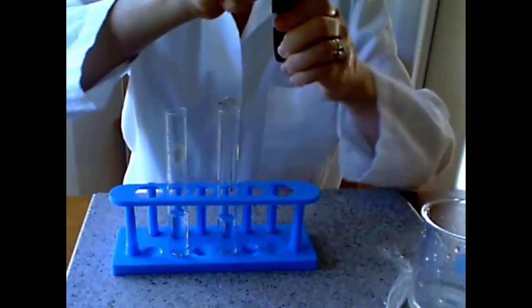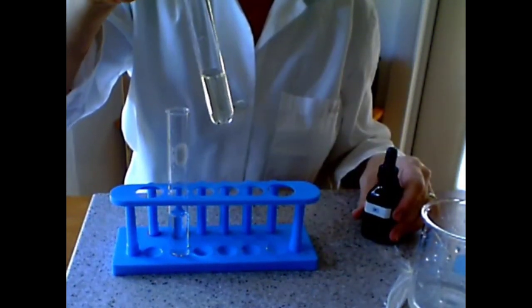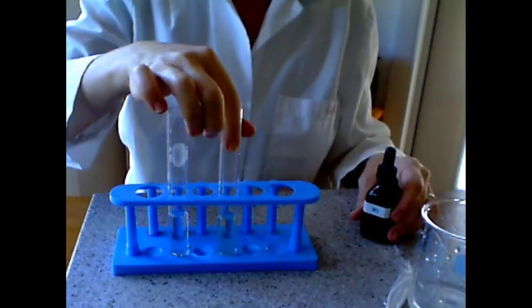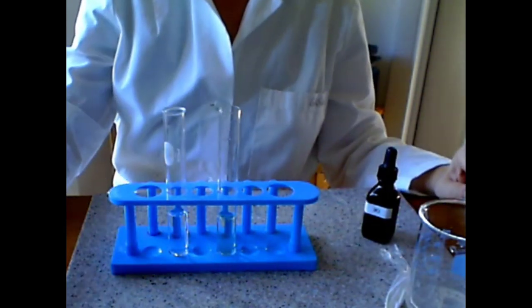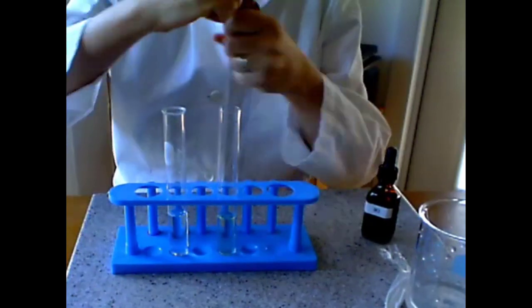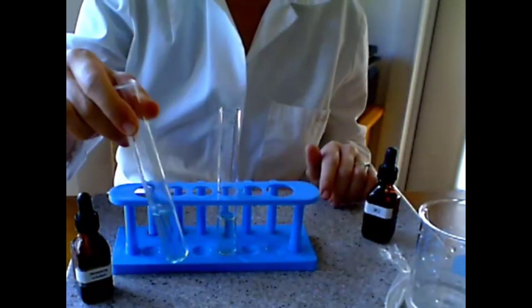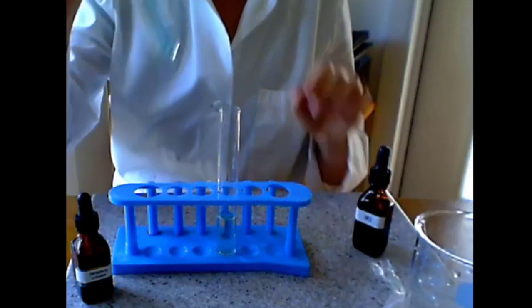Let's start with the IKI. Look well at the color of the solution. And now let's put Benedict in the second test tube. Now we will take this to heat for three minutes.